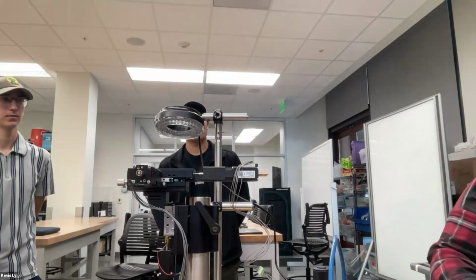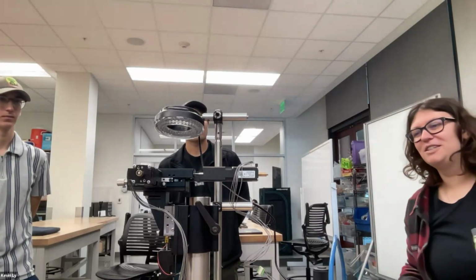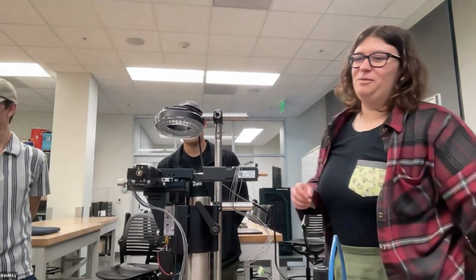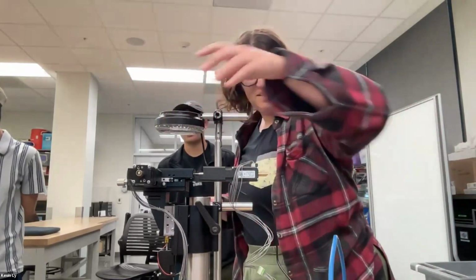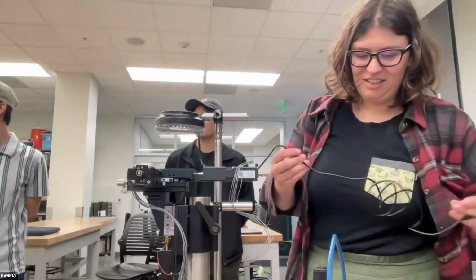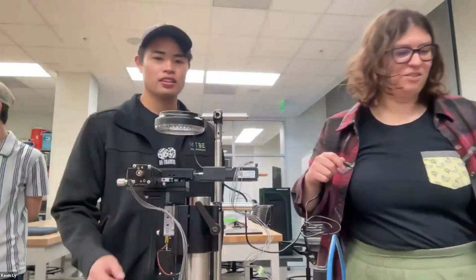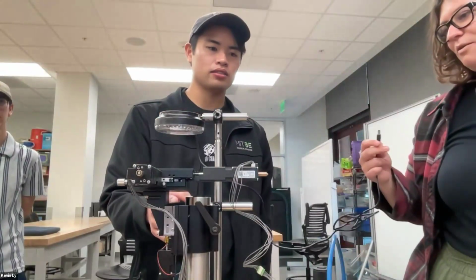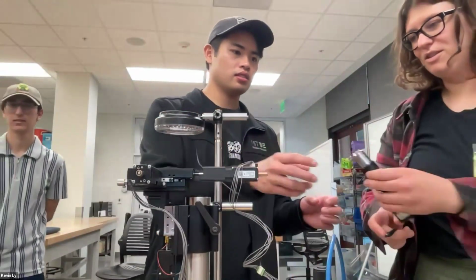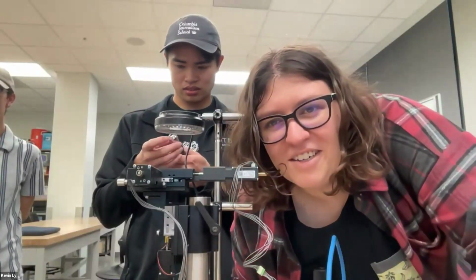Okay, so I do not have a sample. I feel like we can look at something more interesting than a tick in my backpack. Oh, you have a tick? Oh, this also isn't plugged in. I've got a seashell from Monterey yesterday. Oh, that's cool. There's this one that doesn't have an objective. Nice. Just calling quick. Then this should also have power. Hello, am I audible? Yes, hello, Shivam.